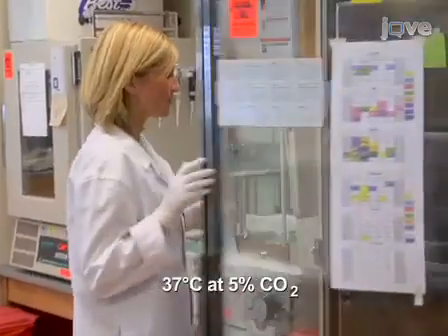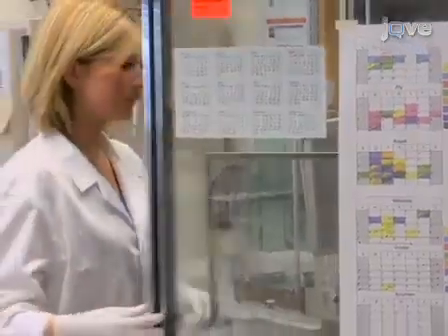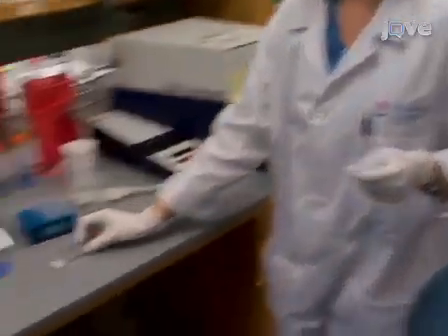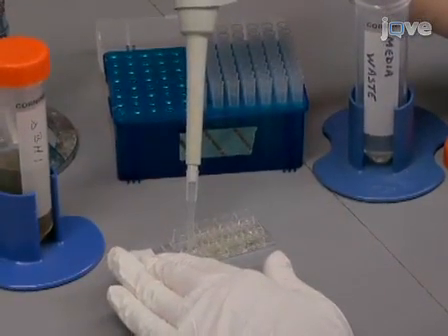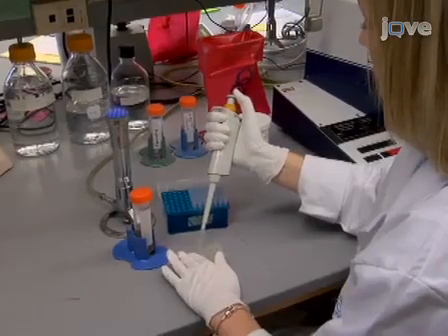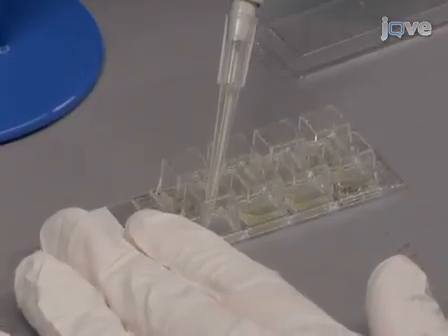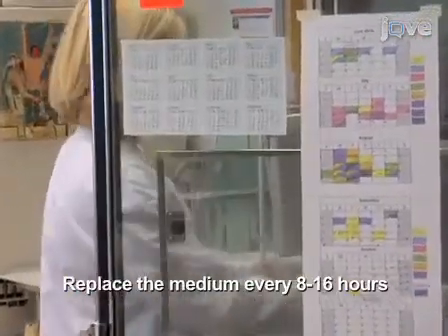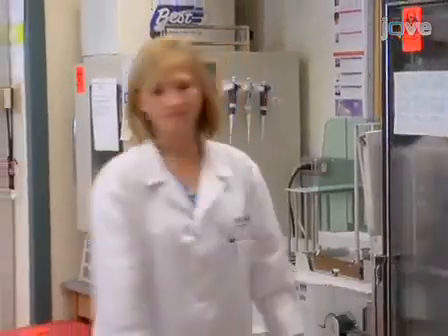Incubate the slide at 37 degrees Celsius in a 5% carbon dioxide incubator to allow the bacteria to begin forming biofilms. 16 to 18 hours later, remove the slide from the incubator and aspirate the medium from the corner of each chamber. Then replace it with 200 microliters of fresh pre-warmed medium. Be sure to dispense the new medium along the wall of the chambers in order to avoid disrupting the biofilms. Return the slide to the incubator and allow the cultures to grow to the desired density, replacing the medium every 8 to 16 hours to maintain bacterial viability.